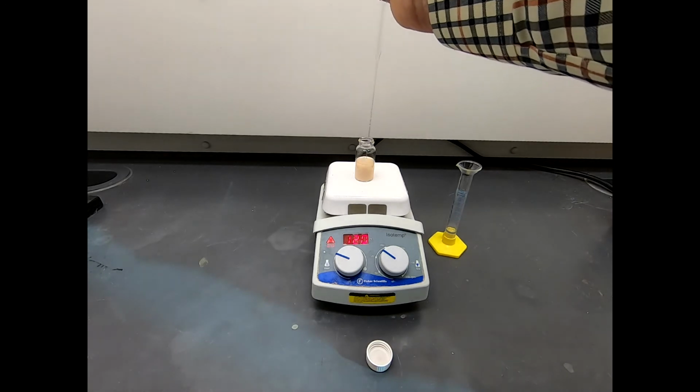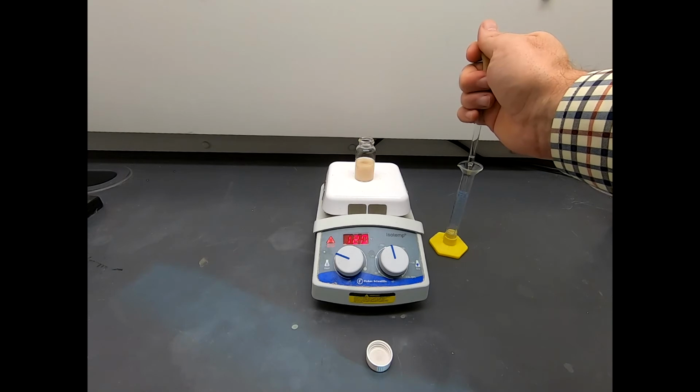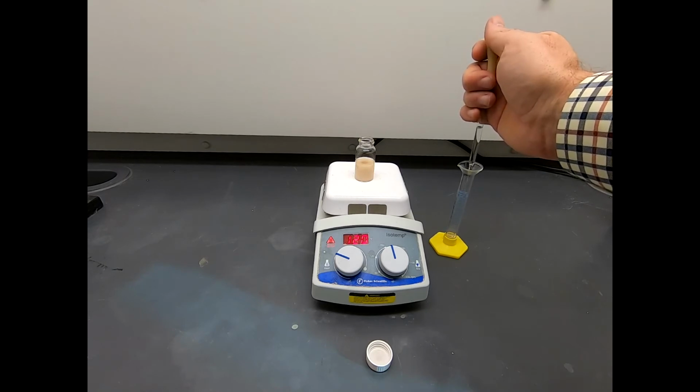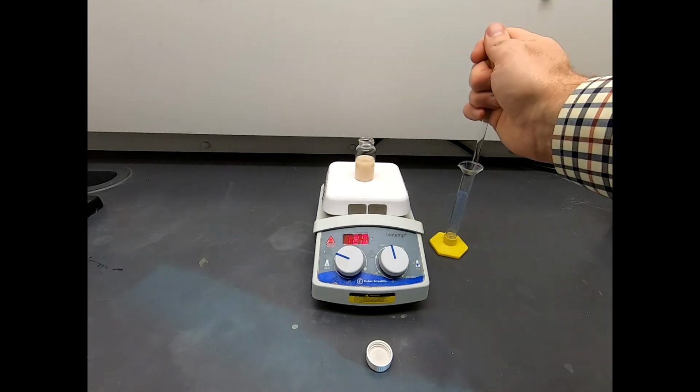And now the polarity is certainly high enough. That product is precipitating out. You can see that it's gotten white. It's gotten white because it's got a lot of solid that reflects the light, and that makes it look brighter and whiter.